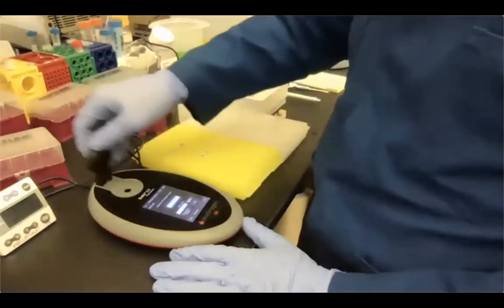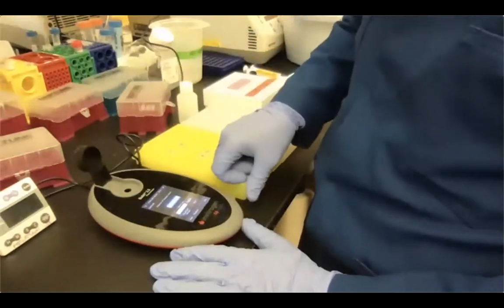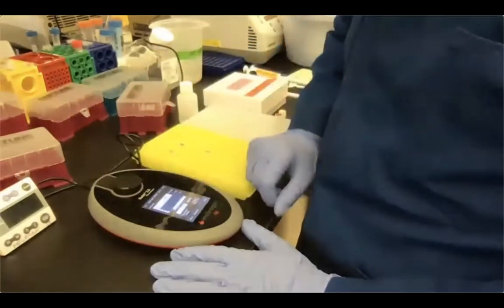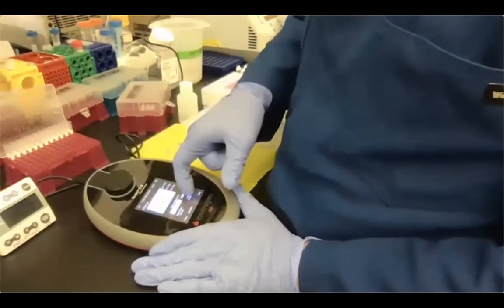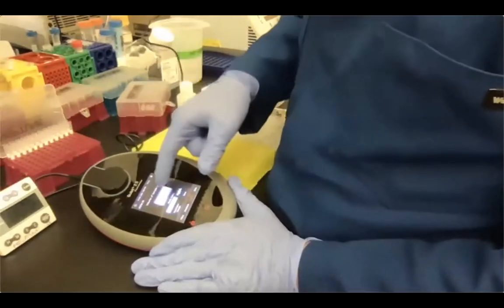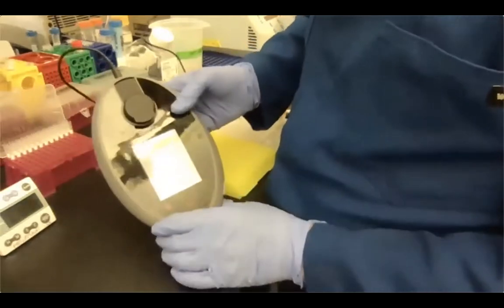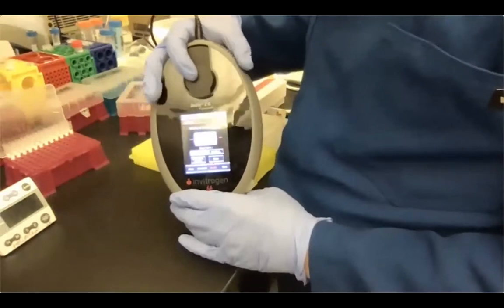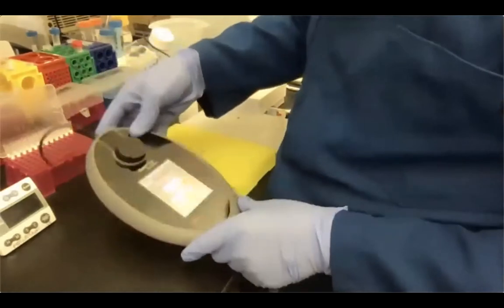So now that I have everything set up and I know it's working, I add sample A, and then I'm just going to read my next sample. I use 2 microliters in here, so I'm just going to calculate the stock concentration and then set it to 2 microliters here. And the concentration of the stock tube, basically what I have in my purified PCR tube, says it's 41.9 nanograms per microliter.